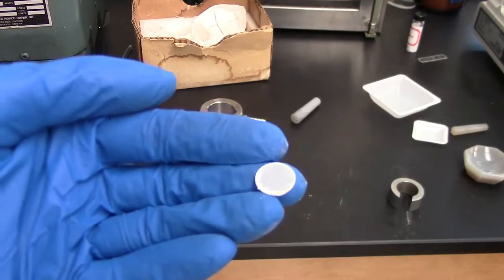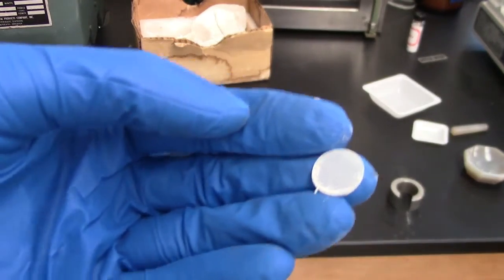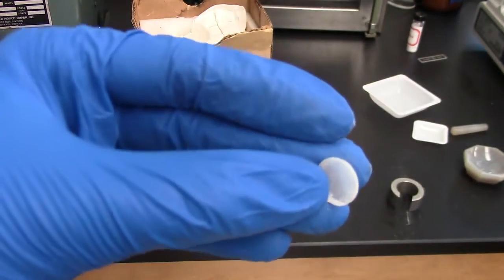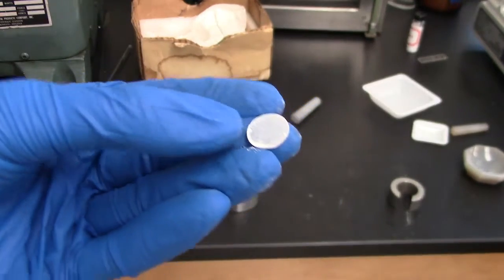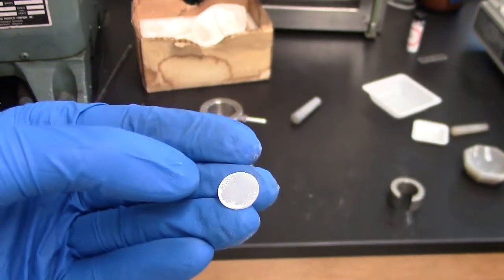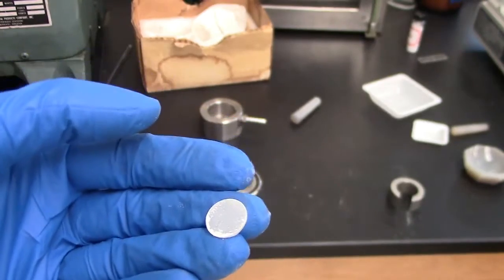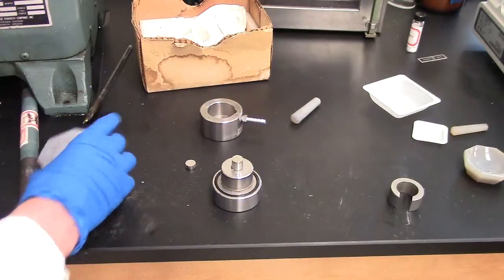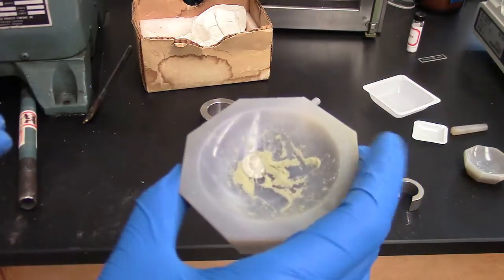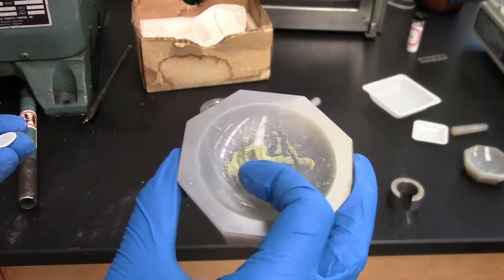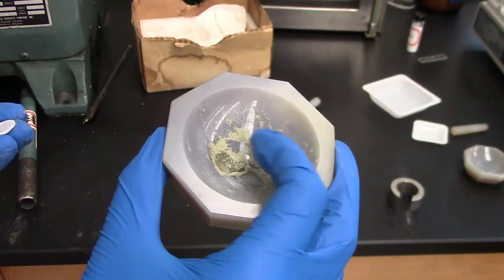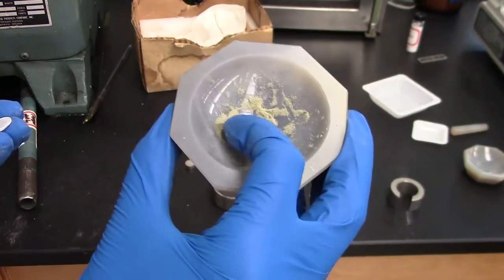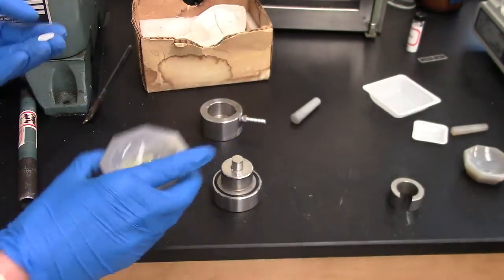Now we can slide our pellet off. So here's what your pellet might look like. It's sort of clear, see through there. You can kind of see it. It's a little bit crumbly. And it's going to look different based on what your substance is. The substance here happens to be green and you can kind of see the IR pellet right here. It's a green color, green clear color.